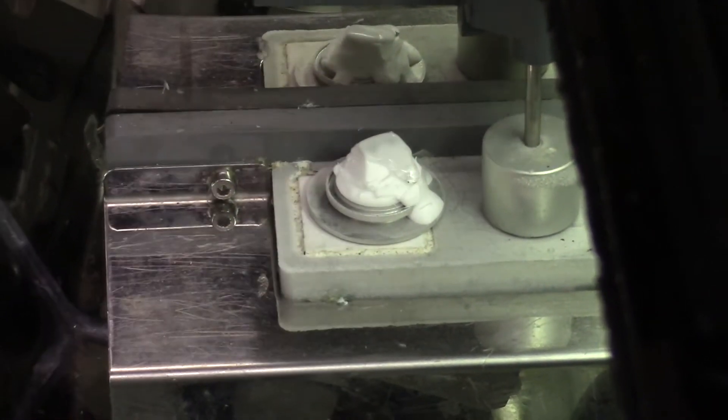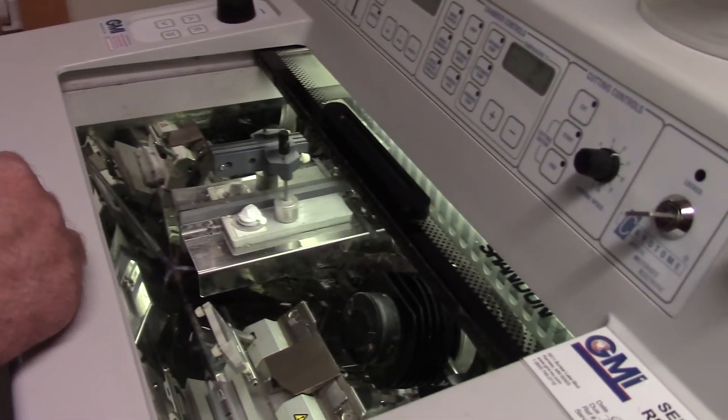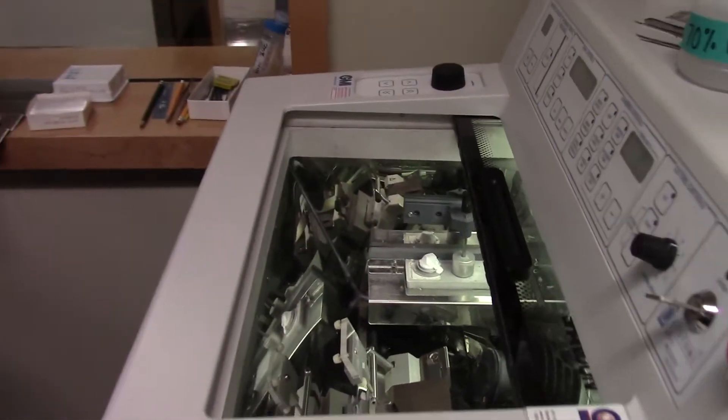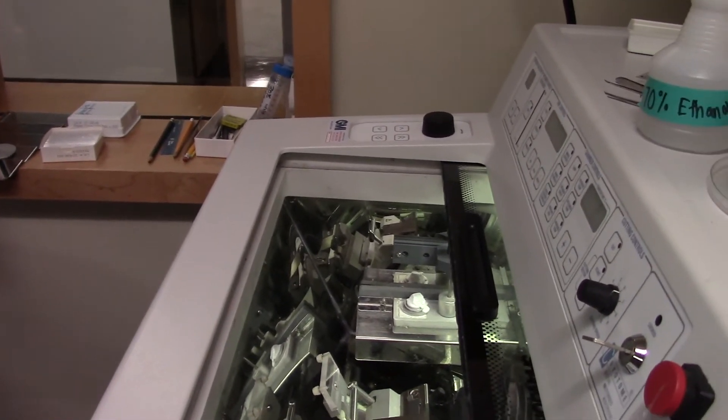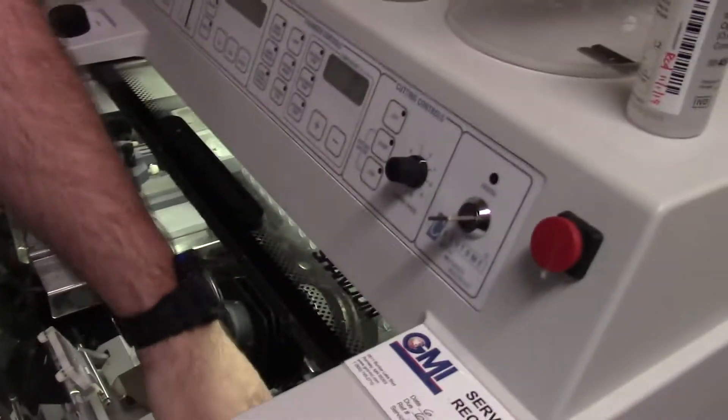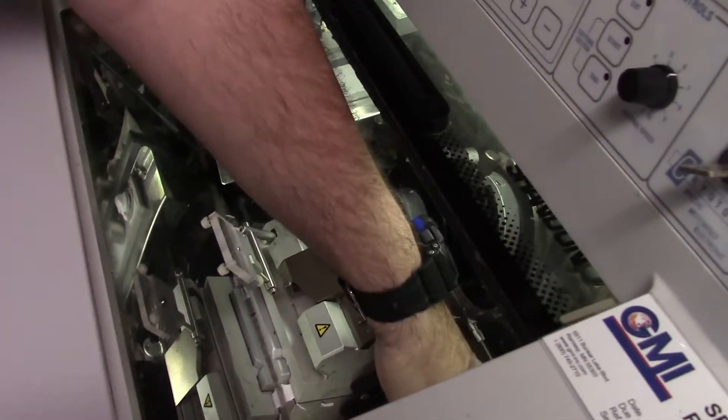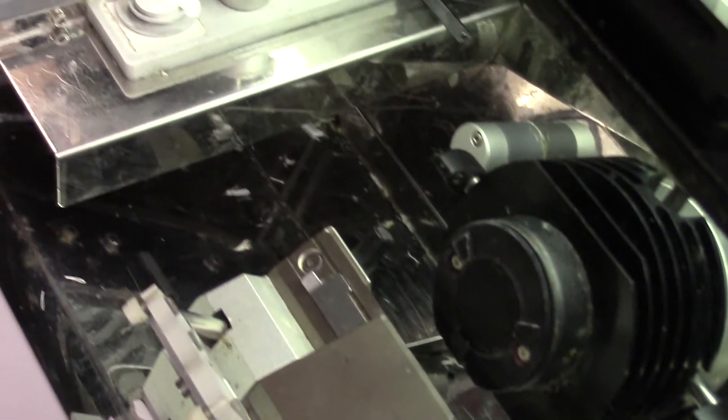Now other things that I have to clean up. We've got a spray bottle of 70% ethanol here. We can grab some paper towels and we want to wipe up all that mess that we have made in the back, in the bottom here, of little shavings of ice that don't even have our tissue in them.